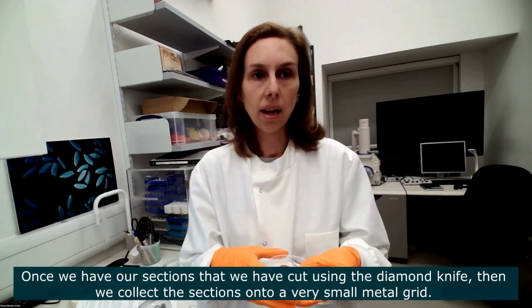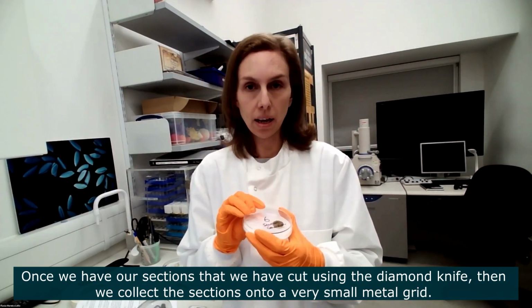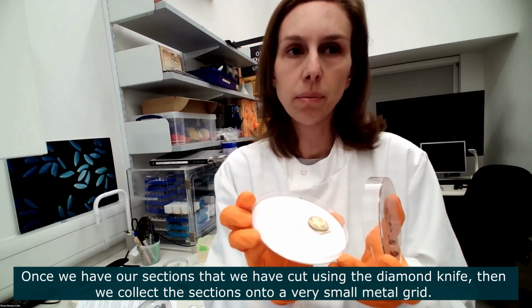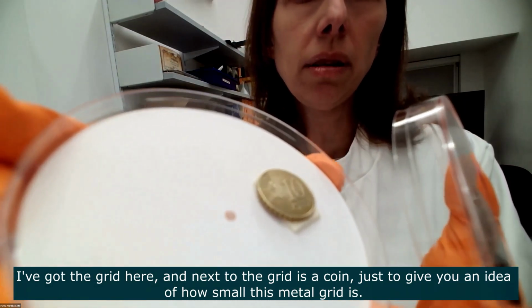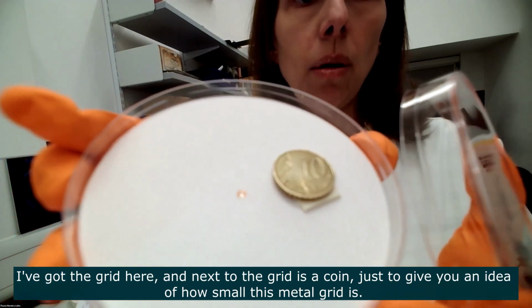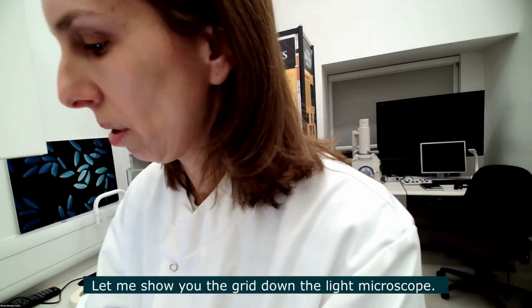So once we have our sections that have been cut using a diamond knife, then we collect the sections on a small metal grid, very small metal grid. And I've got the grid here with me. I'm going to show it to you down the microscope. Next to this grid is a coin, and you can see how small the grid is compared with the coin.